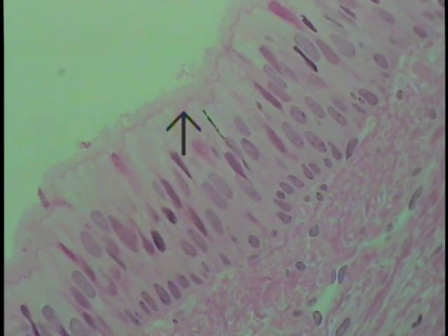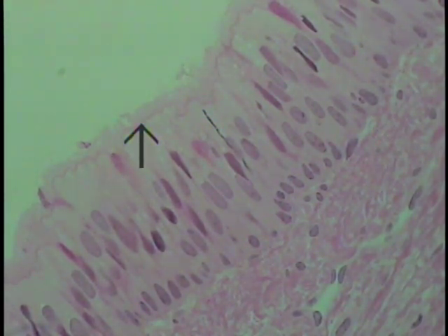One gets a better appreciation at this increased magnification, with the slightly better preparation, of the depth of the epithelium, the multiple layers of nuclei that it presents, though it is a form of simple epithelium, and one can actually visualize the ciliated surface shown at the arrow and begin to appreciate the basal bodies that form the axonemes to these cilia on the apical surface of the cell.